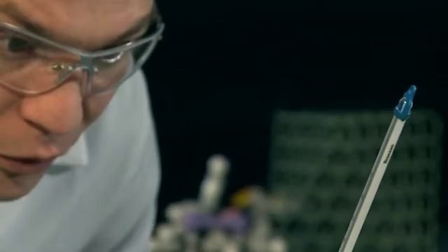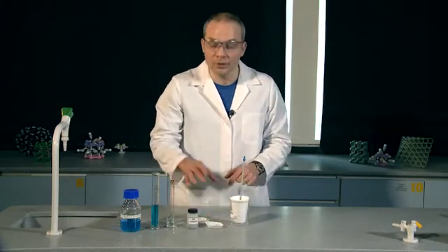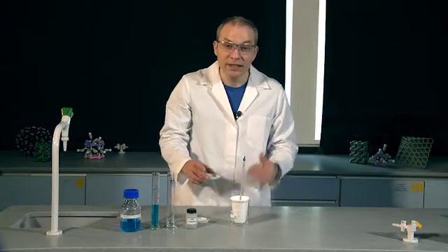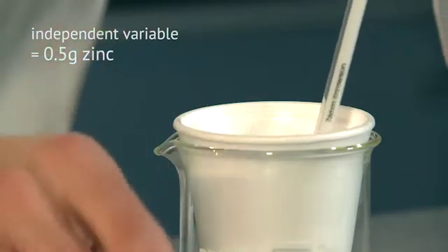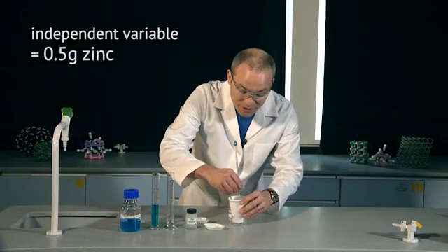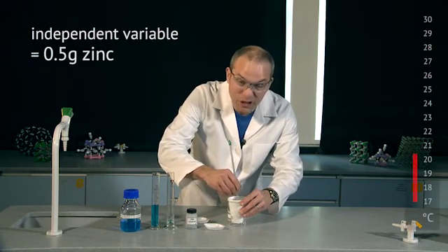I've got a reading of 17.0 degrees C. I've pre-weighed a couple of masses of zinc — 0.5 grams and 1.0 grams — so I'm going to add the 0.5 grams first. I'll stir the reaction mixture thoroughly and look for that maximum rise in temperature. Be careful not to stab the thermometer through the base of the polystyrene cup as you do this — it does happen a lot in class and it ruins the experiment.